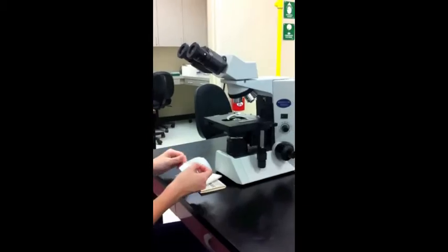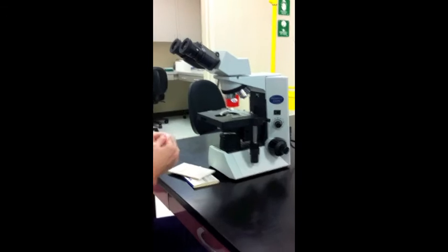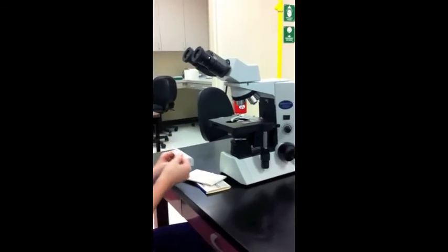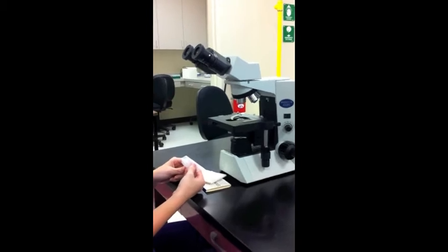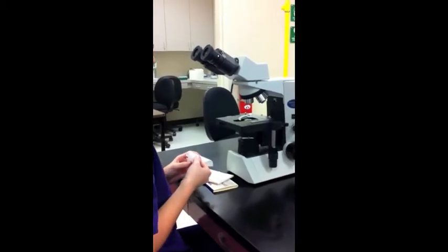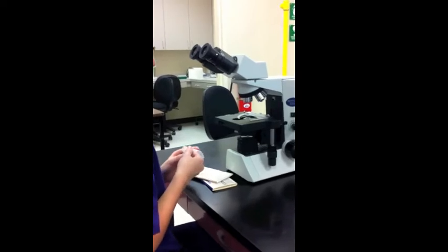At this point, the microscope is on the table, ready to be worked with, and we are now ready to start using your microscope in 15 easy steps. The first step, one, clean objective lenses and ocular lenses using lens paper.